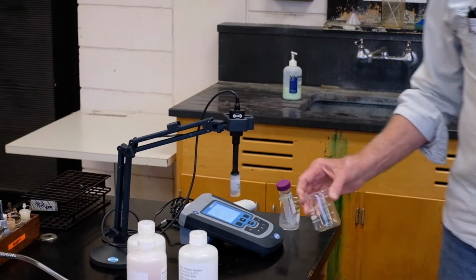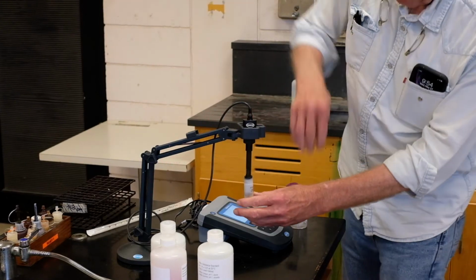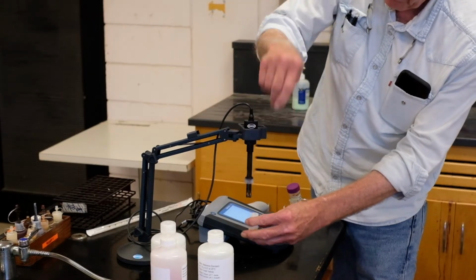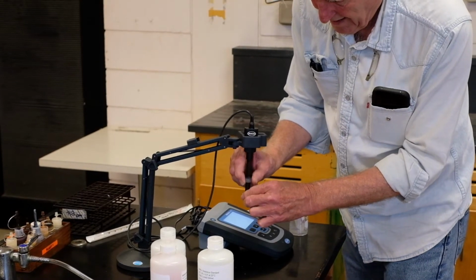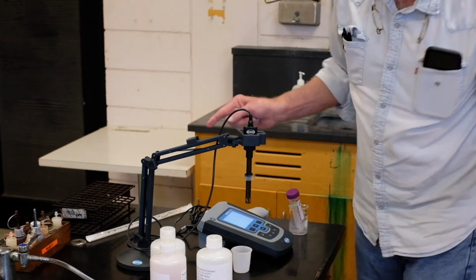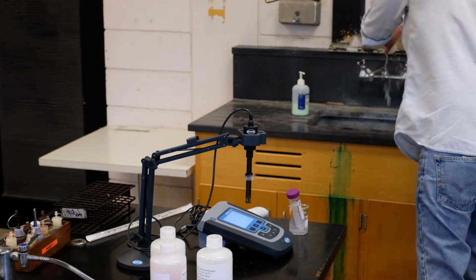Now, I got a vessel. And what we're going to do on a pH meter, it takes a little bit to stabilize. We keep a buffer over the probe. This is a combination pH probe, measures in millivolts, converts it to a number. These probes have a little hole in it so that they measure the hydrogen ion concentration. I always like to rinse that off.